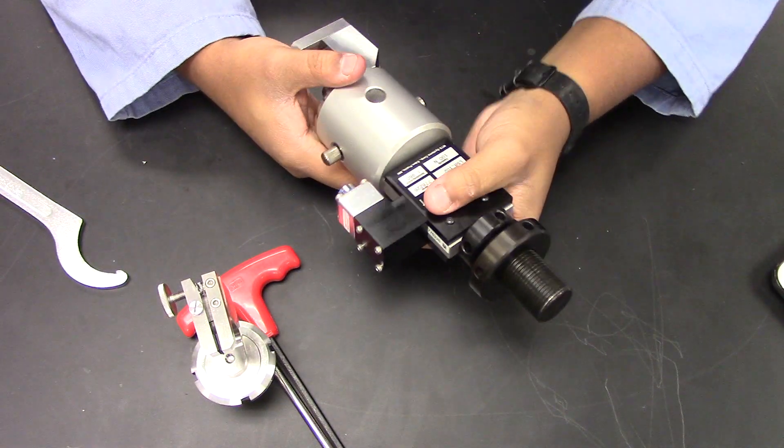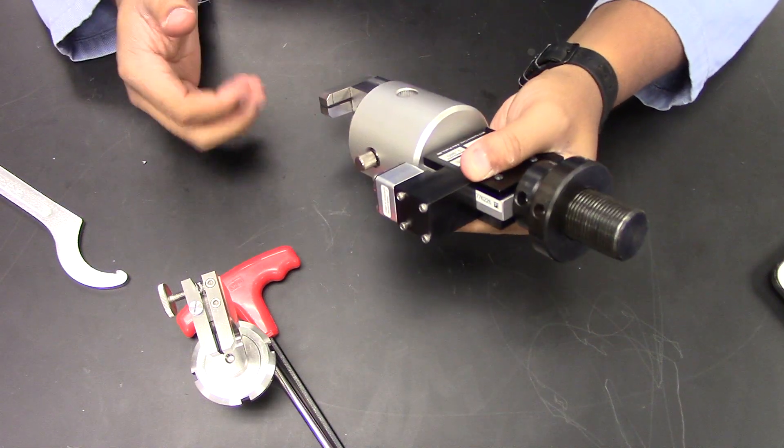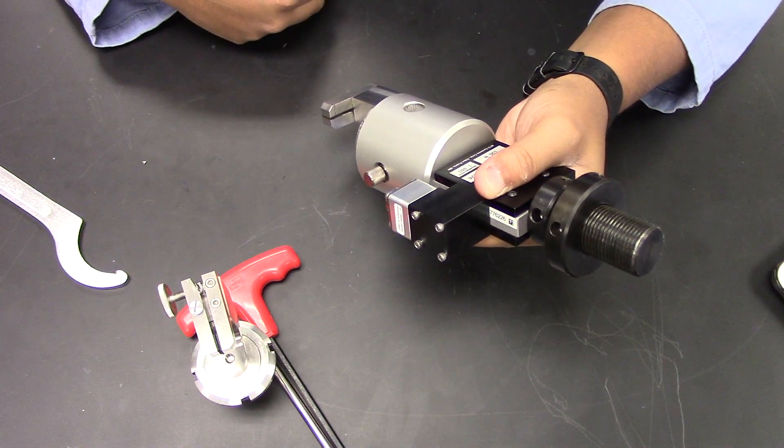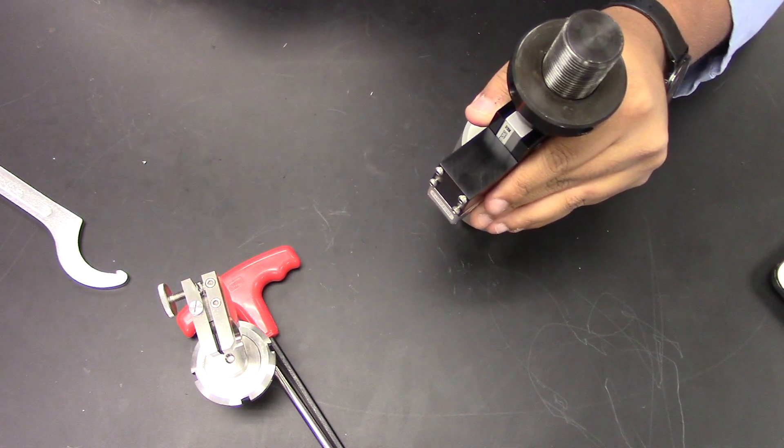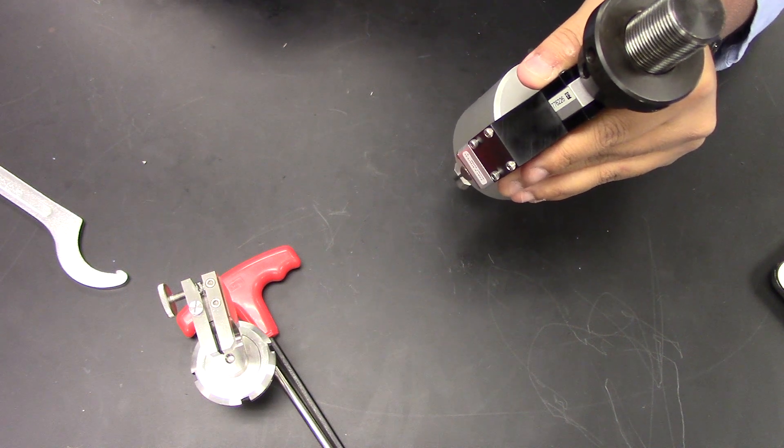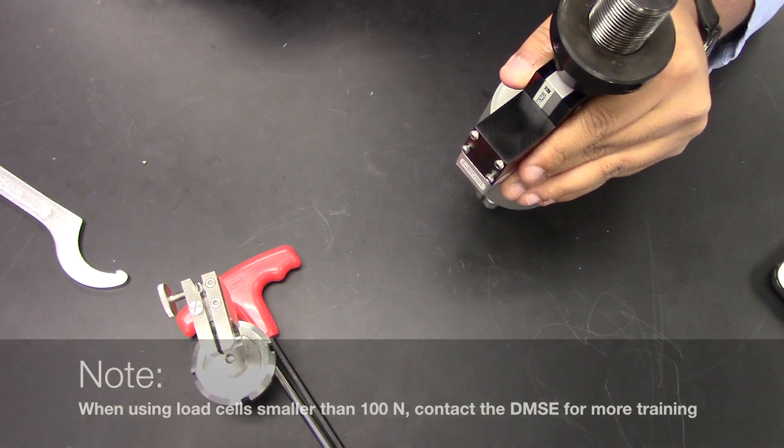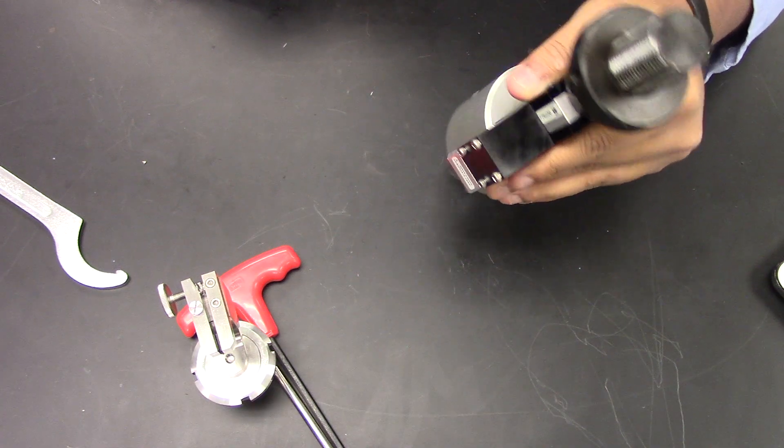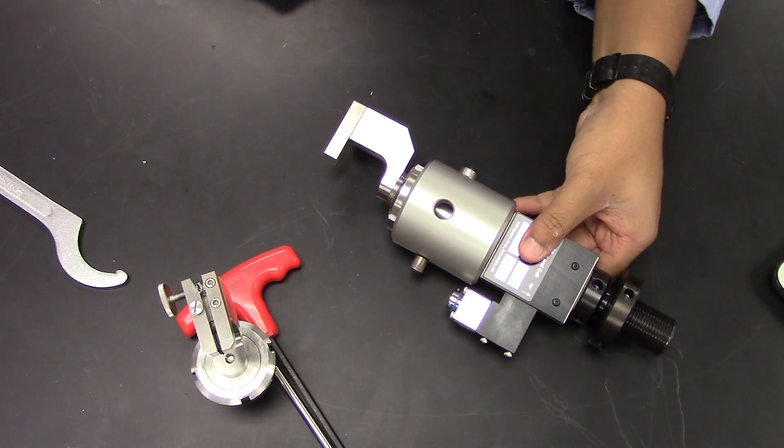Now, this procedure can be generalized for low force grips of any sort. The system is now complete and can now be placed into the tensile tester. As a warning, don't make the common mistake of holding this by any other part other than the load cell. Doing this creates torque on the load cell that could potentially lead to errors in your data or the destruction of the load cell. Make sure that the system is only held by the load cell to prevent that from occurring.